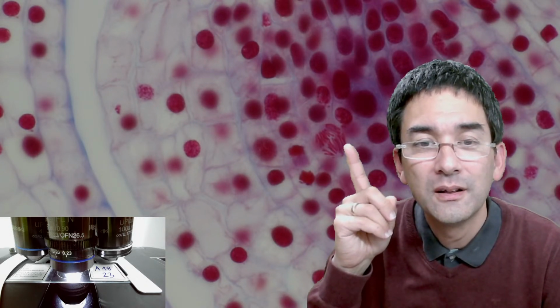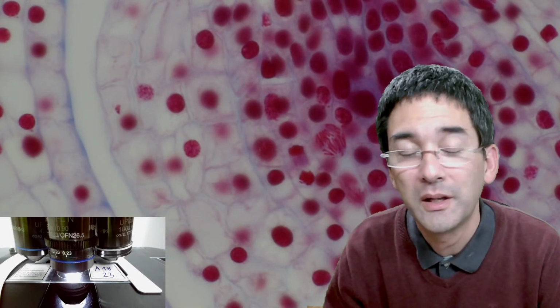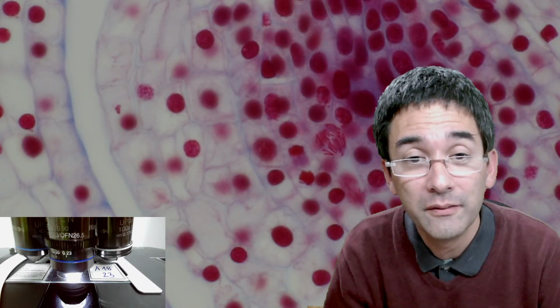Yeah, you see? Also when I focus, yeah, lots of chromosomes. Yeah, they're pulled to the equator of the cell. We can see DNA. Honestly, I love this because it's really unbelievable what microscopes are able to do here.